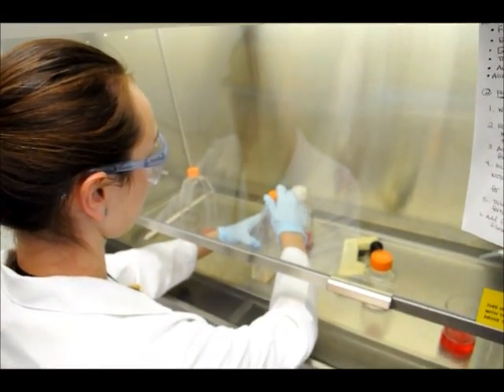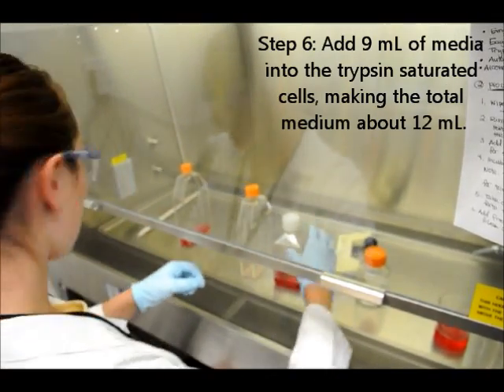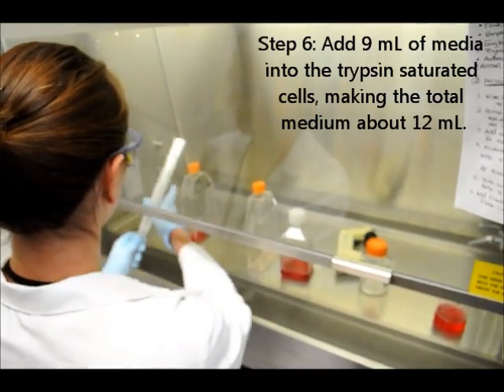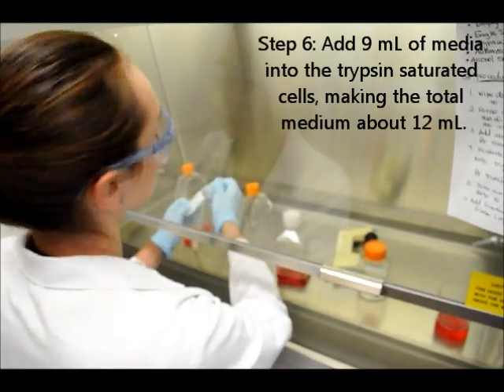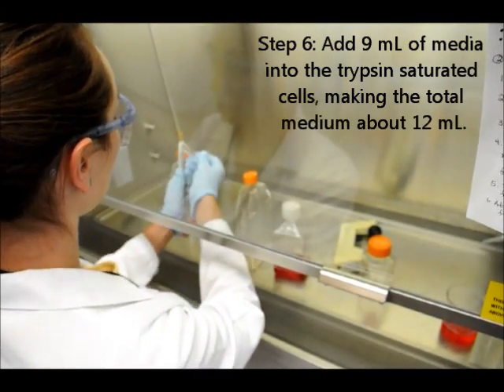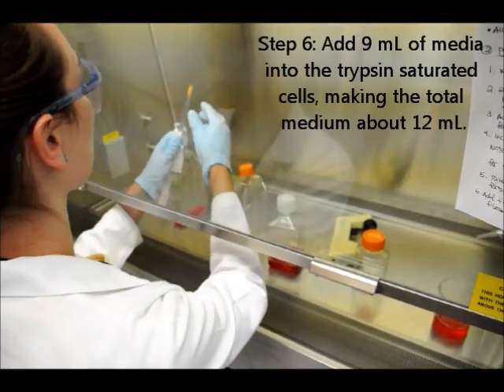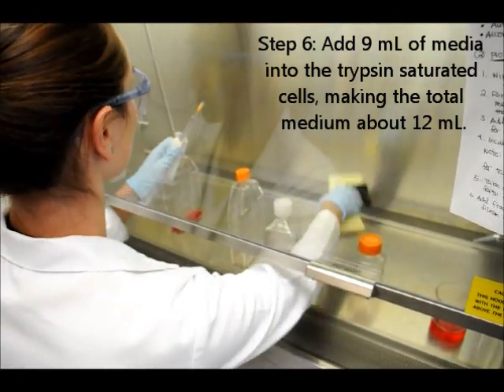We are going to add 9 mLs of media to make a total of 12. So, we started with 3, 9, 12. Don't touch this with your hands.